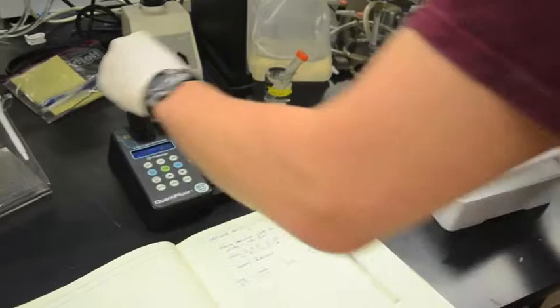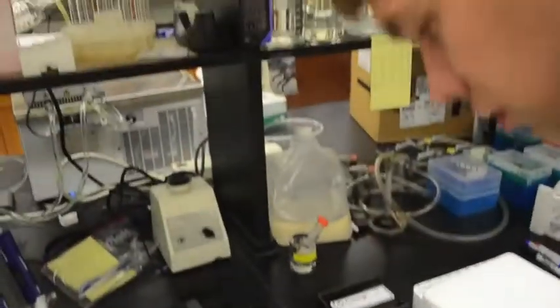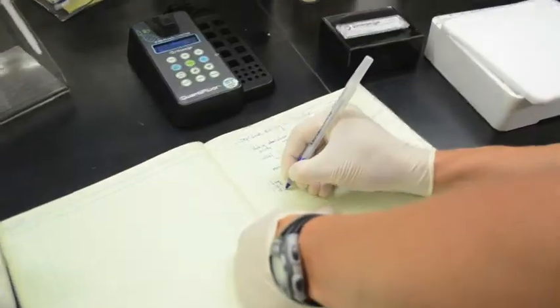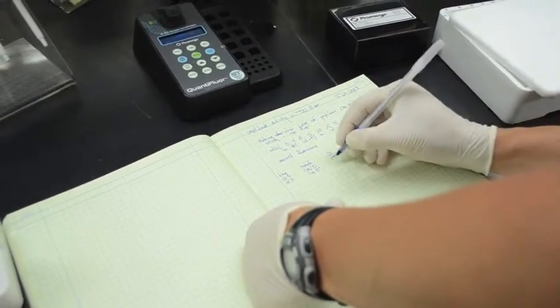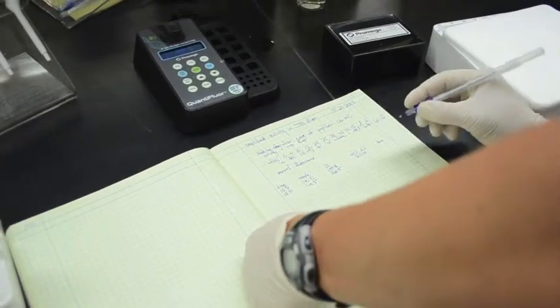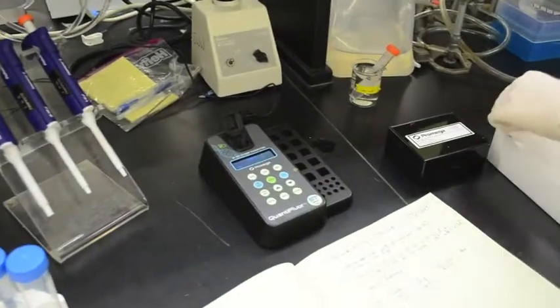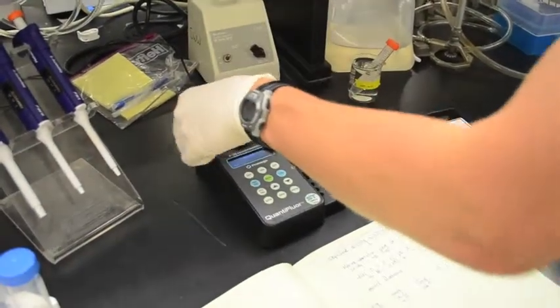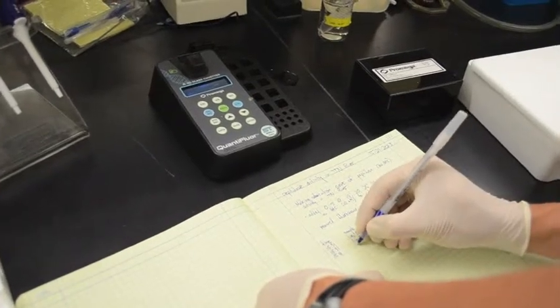So then I'll just go down the row, try and measure these nice and quickly. Time is still 1531. Fluorescence on this one, this was the live 5 microliters, and the fluorescence was 266.5. And I'm going to measure the solid standard once for every row that we measure. So I don't measure it every single time; for every row of cuvettes that we measure, I measure the solid standard. For the most part, it doesn't drift too much, but we always want to know if it does start to drift.